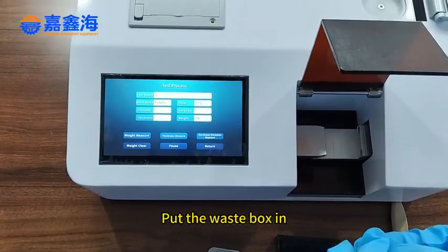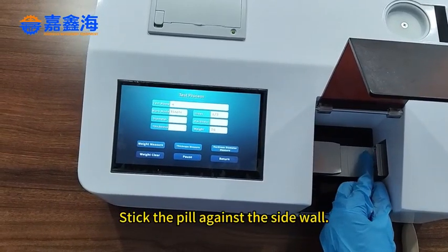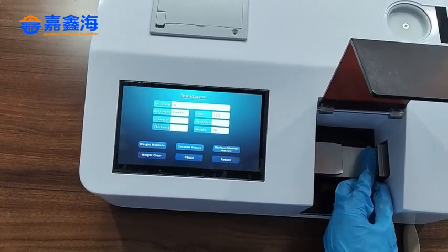Put the waste box in. Stick the pill against the side wall.